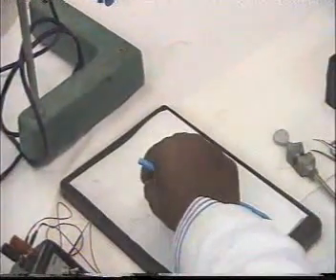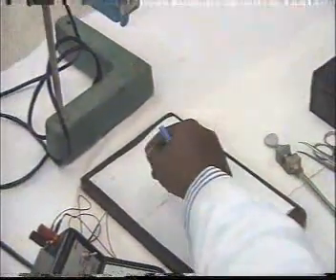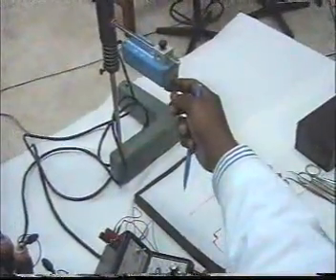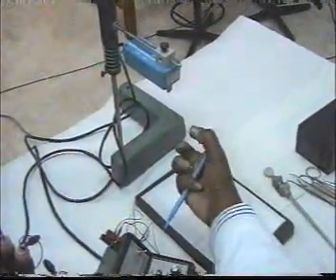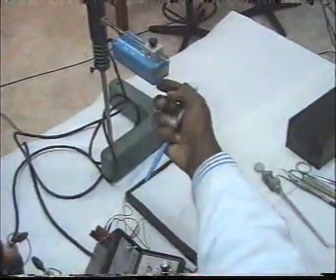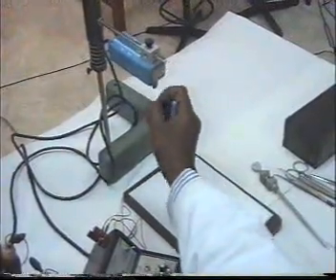We go to the preparation here, the muscle. We fix the muscle by the pin, and then we tie the thread, and the thread will be fixed here. So when the muscle contracts, there is muscle shortening, and it will pull from here. This one will be pulled down.